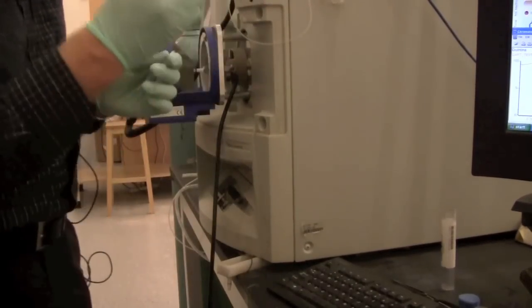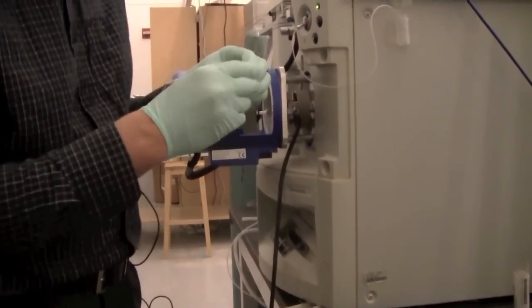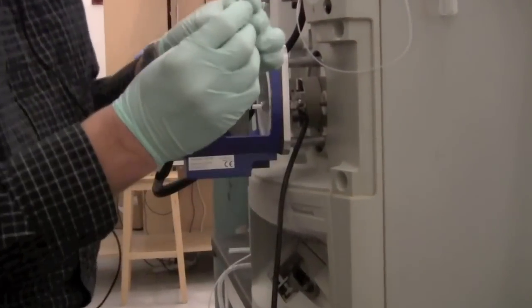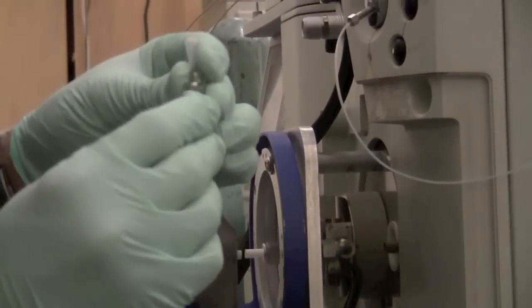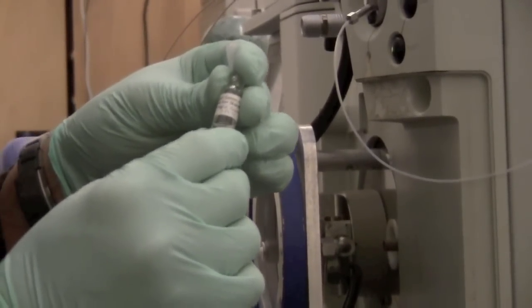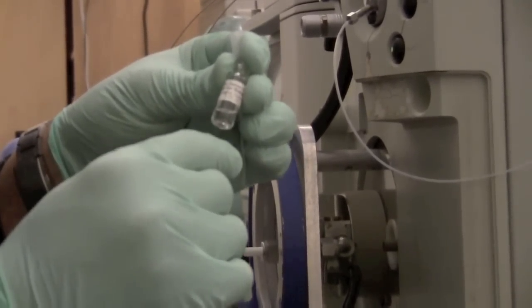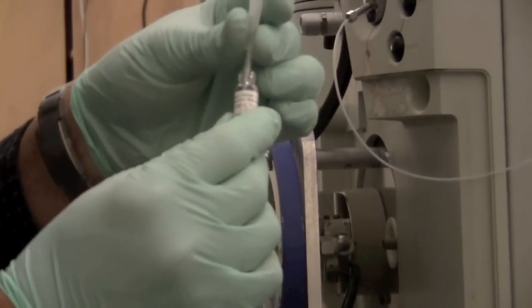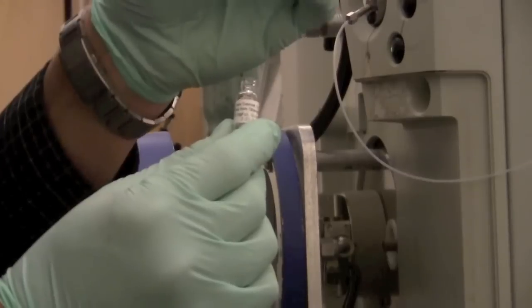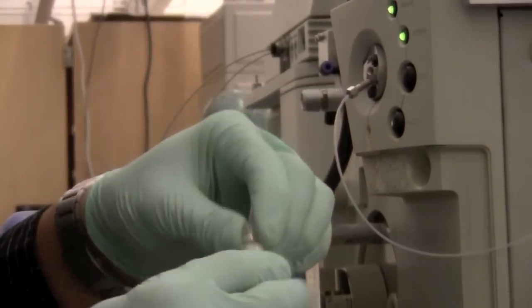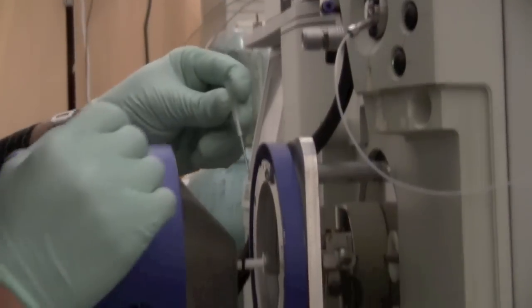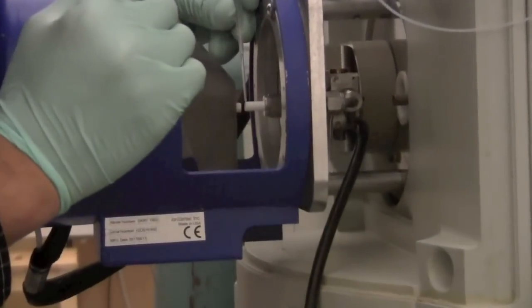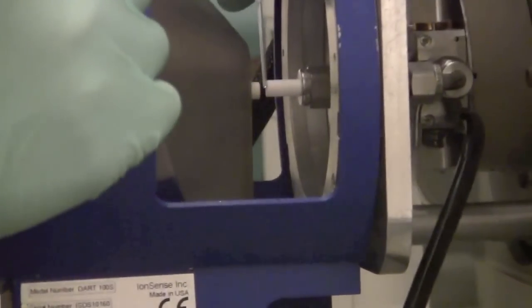For a solution you can dip your sample. You dip the capillary into your sample. This sample is quinine 10 nanograms per microliter. Remember that mass spectrometry is a fairly sensitive technique, so you do not need the concentration to be all that high. In this case we can just dip the capillary into the sample. We can let it dry a little bit.